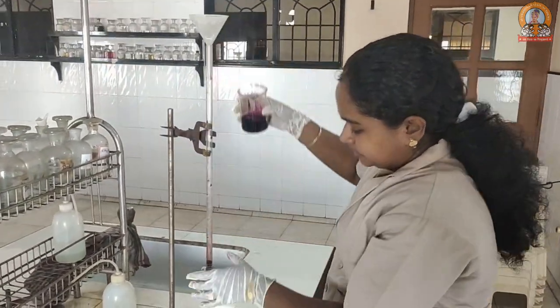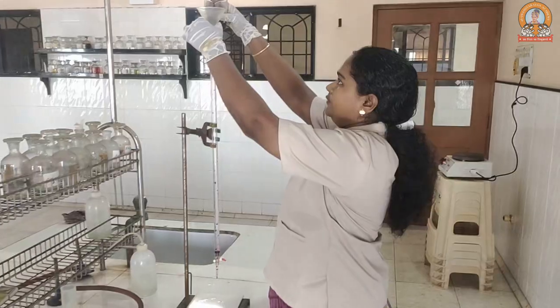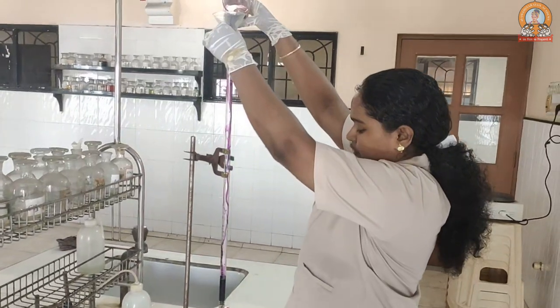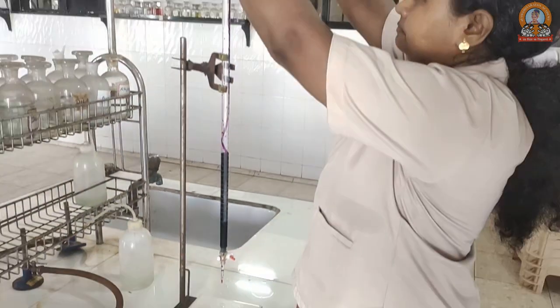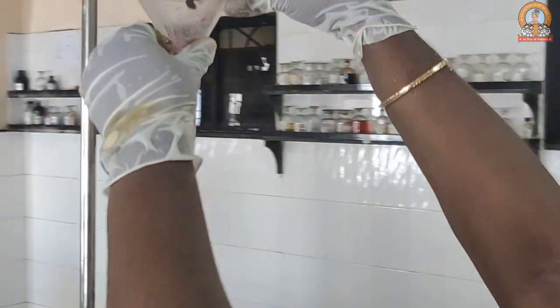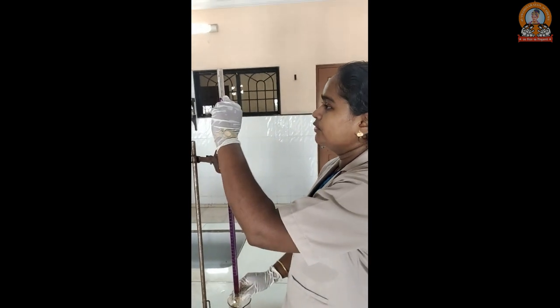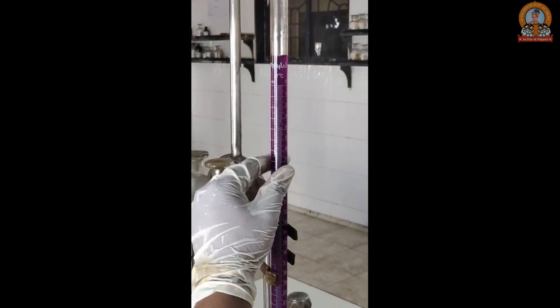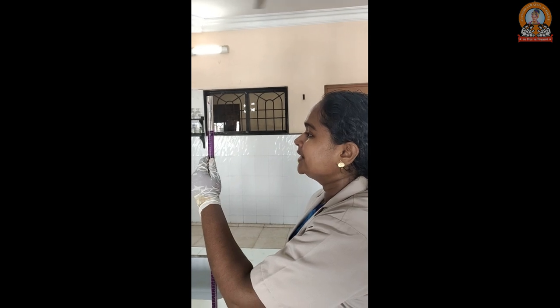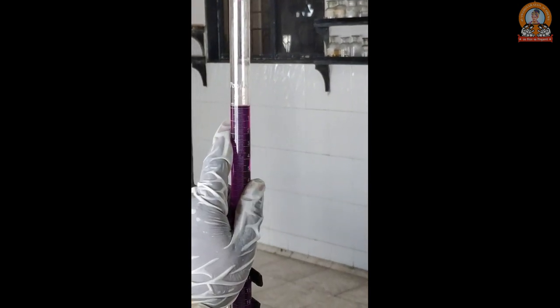Fill the burette. First, see the level — your burette stopper should be totally closed so that while pouring the solution it does not pour out. The burette should be filled above the zero level. It's a 50 mL burette. Fill your burette with KMnO₄ above the zero level. Keep your eye view parallel to the zero level — that's the first condition. Then bring the upper meniscus to the zero level.